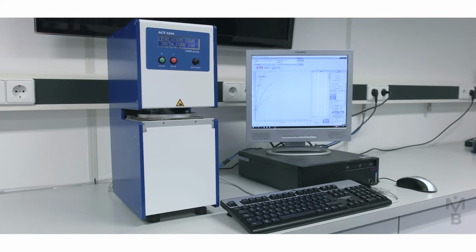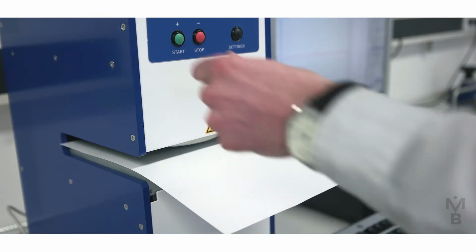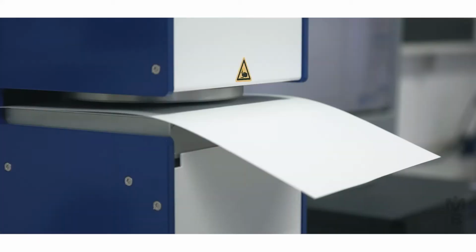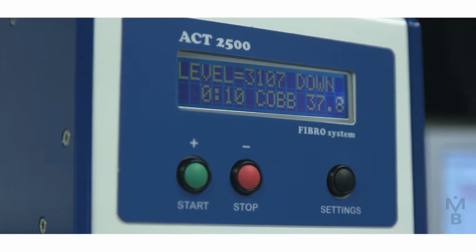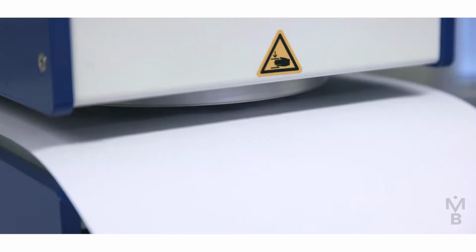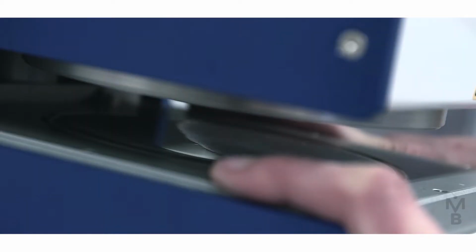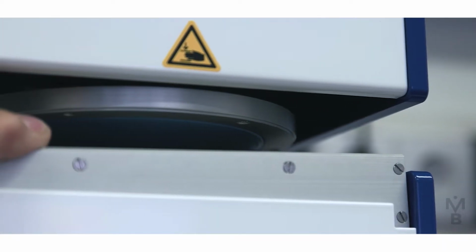The Absorption Characteristic Tester, or ACT: a sized or coated specimen is placed on a porous glass disc, 100 square centimeters, from which the specimen draws water, and the uptake of water is continuously monitored to produce a dynamic absorption curve automatically. We have two chambers. We have a chamber with an LVDT or sensor assembly, and the other chamber where the actual water is transmitted into the porous glass disc and then obviously into the paper specimen. The paper specimen is held by a rubber membrane.